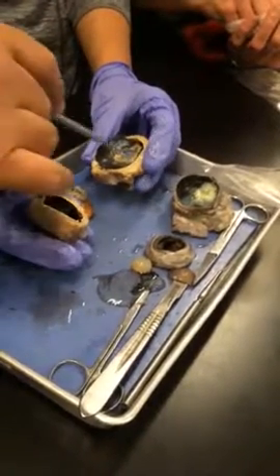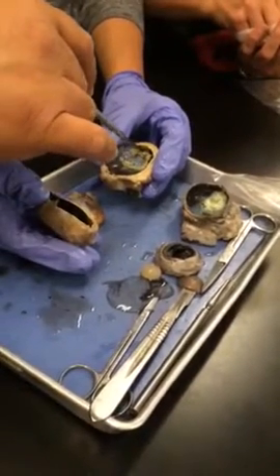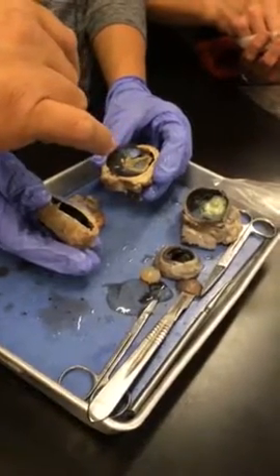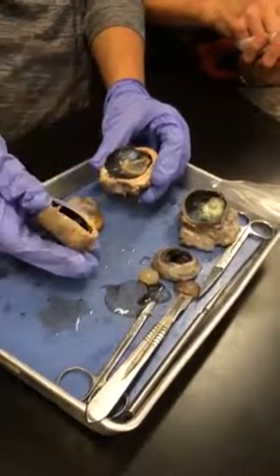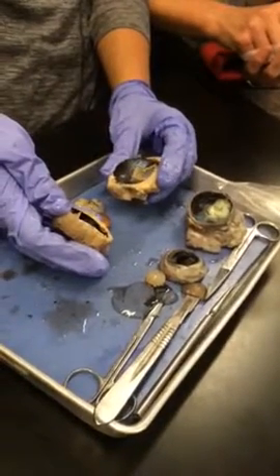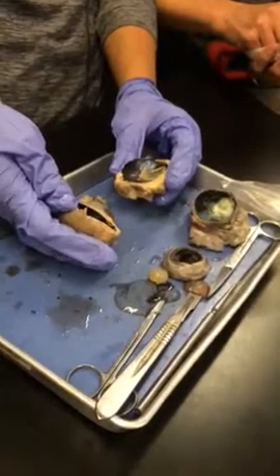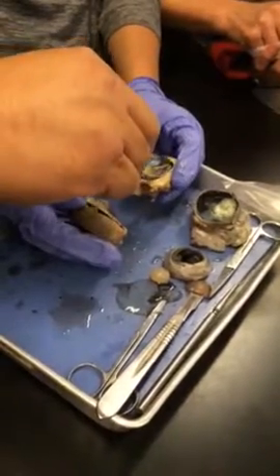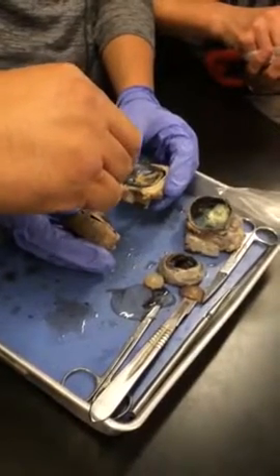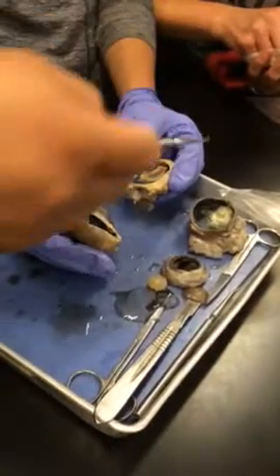Neural tunic. What is the structure? This is the retina. Right? If this is the retina, identify 3 types of cells that you could find within this structure. Ganglion, bipolar, sensory receptor cells, which would be rods and cones. Right? Identify the little region here. Optic disc, also known as blind spot, and then behind that, what do we have?